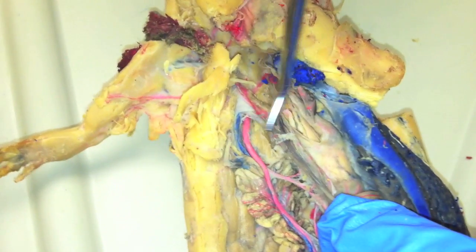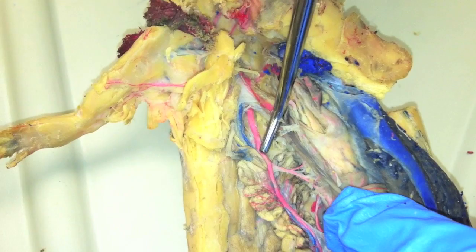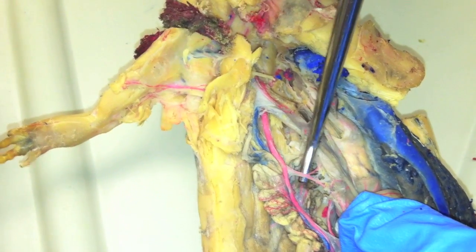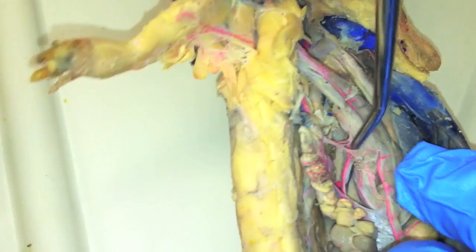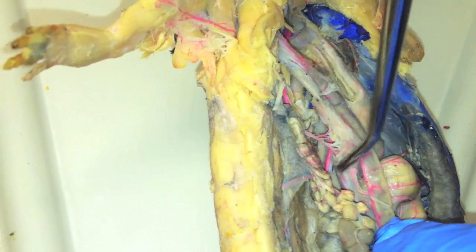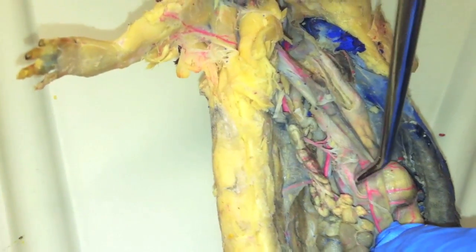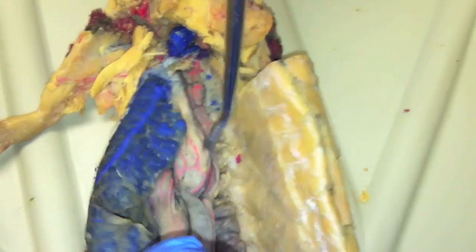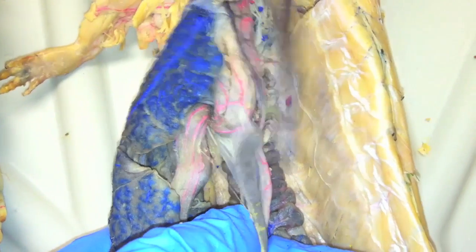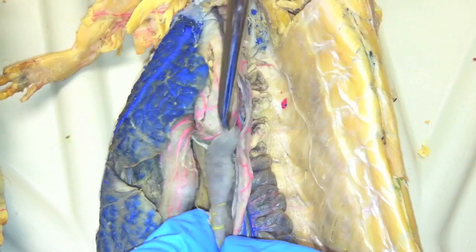Right now we're on the dorsal aorta. If you follow the dorsal aorta down, we're going to branch to the gastric artery. All this branching should lead you to the splenic artery, which comes down — and there's the spleen. That's the artery leading down to the spleen.